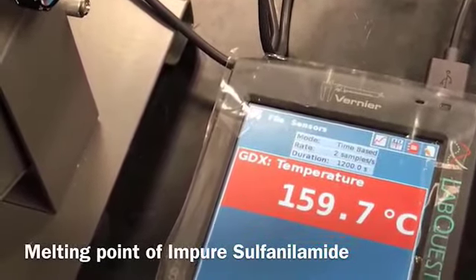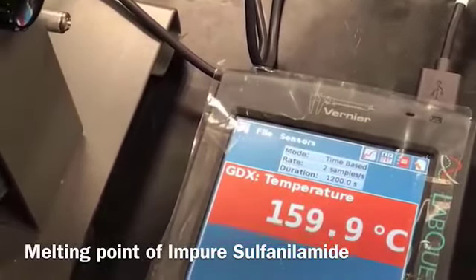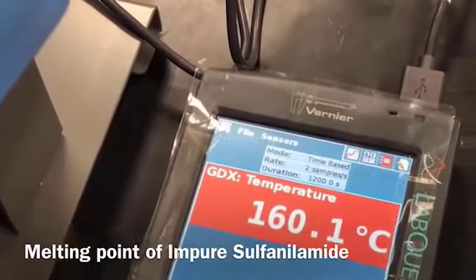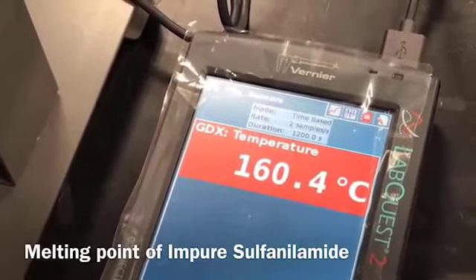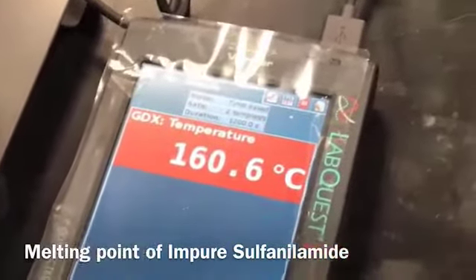It's almost there. It's all melted now. So you can see 160.4 degrees centigrade.